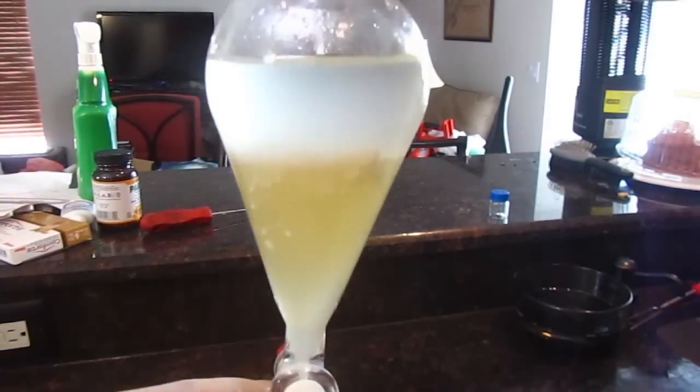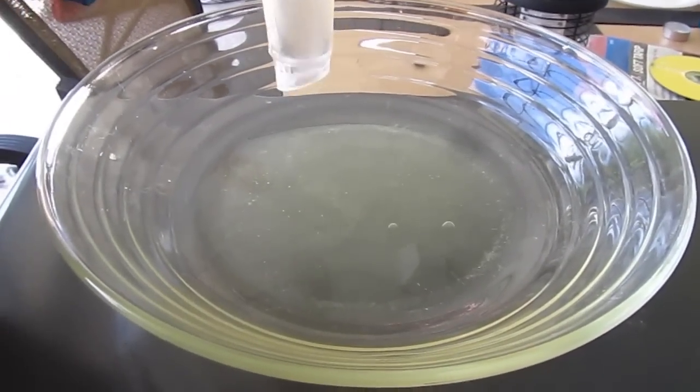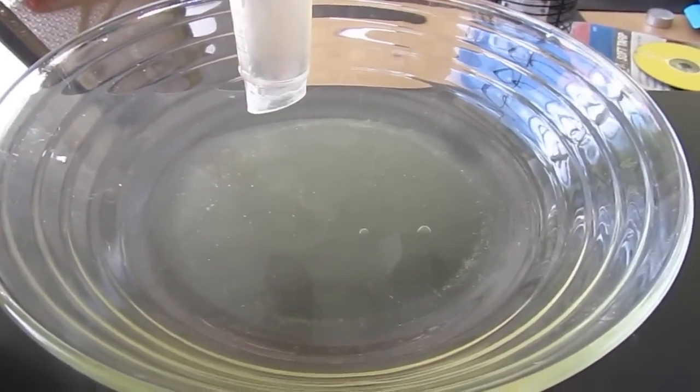So as you can see, the two layers are formed, and there's some salts. All right, now we're going to set it out to drop while we're waiting. All right, good luck. Take care.